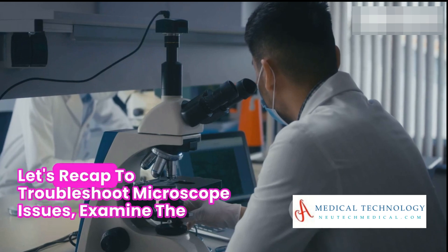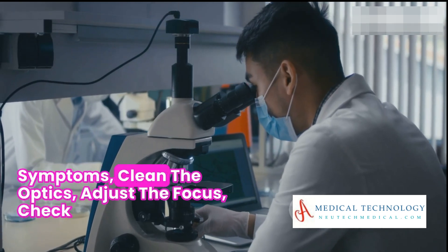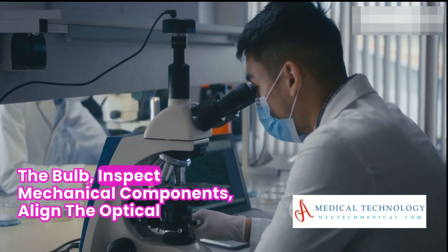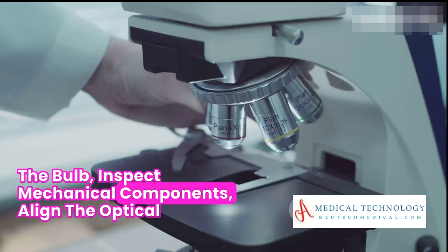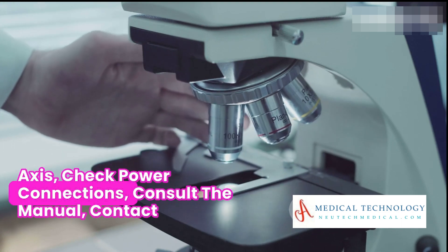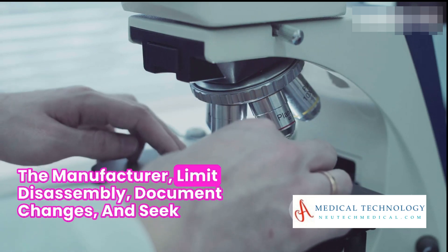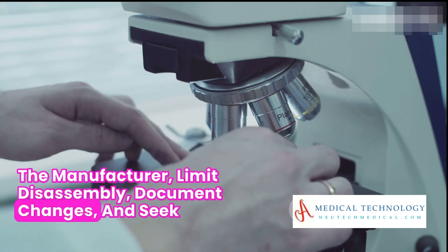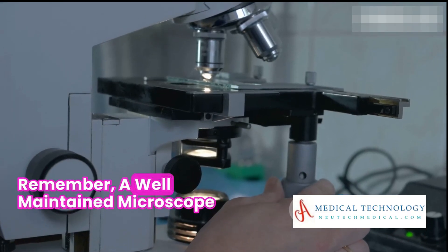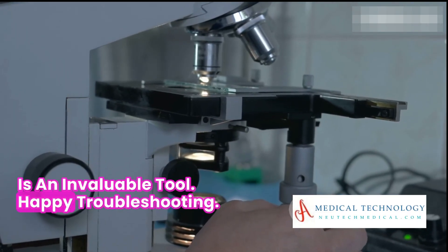Let's recap. To troubleshoot microscope issues: examine the symptoms, clean the optics, adjust the focus, check the bulb, inspect mechanical components, align the optical axis, check power connections, consult the manual, contact the manufacturer, limit disassembly, document changes, and seek professional repair when necessary. Remember, a well-maintained microscope is an invaluable tool. Happy troubleshooting.